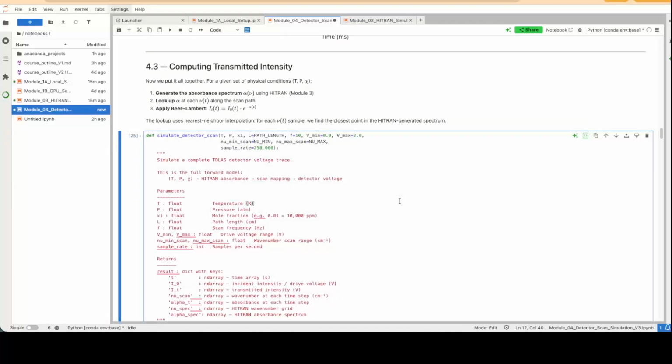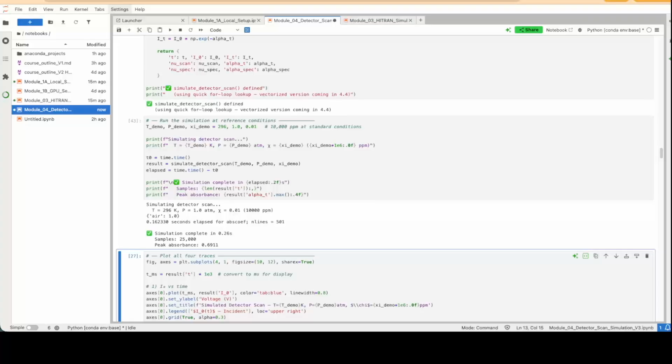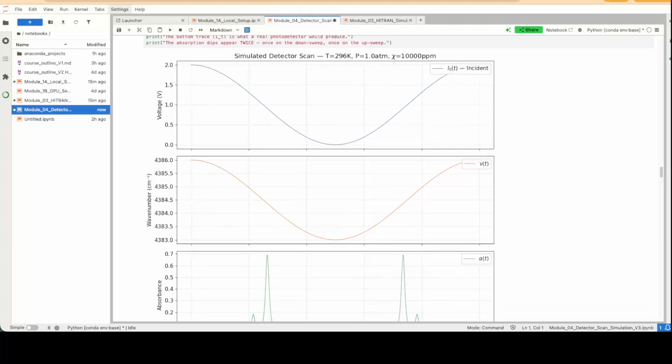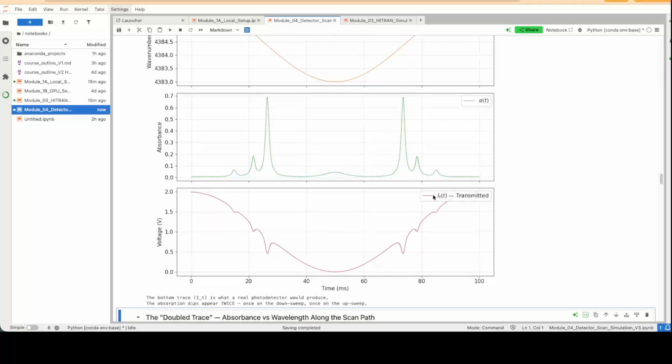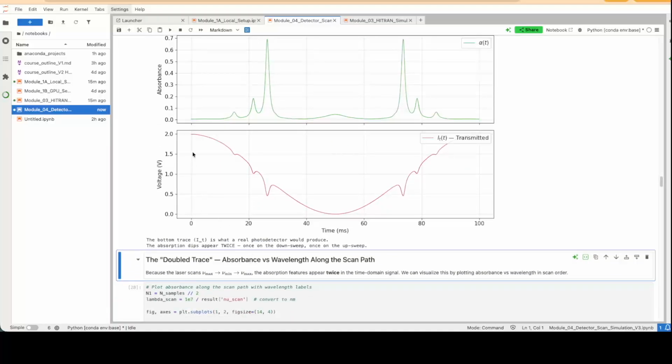Now that we have a mapping from wave number to time, for certain conditions we can go ahead and plot what that looks like for transmitted intensity. So here's what the incident intensity would look like. Here's how wave number is changing over time. The absorbance versus time: we're scanning across, then coming back. So upscan, downscan, however you want to look at it. And then the transmitted intensity, this is what it would actually look like on the detector.